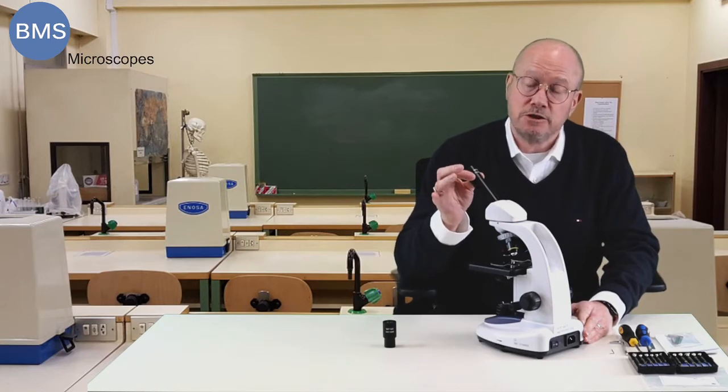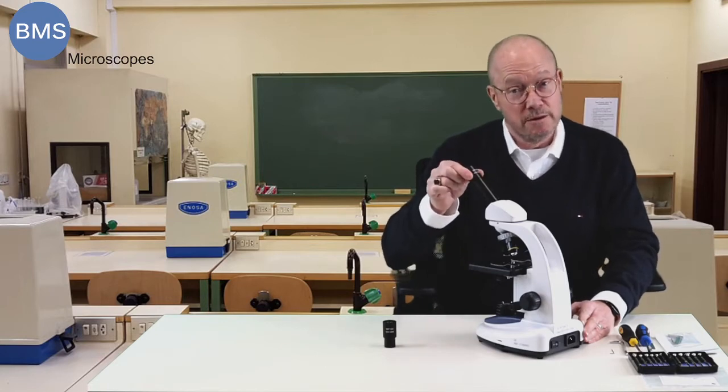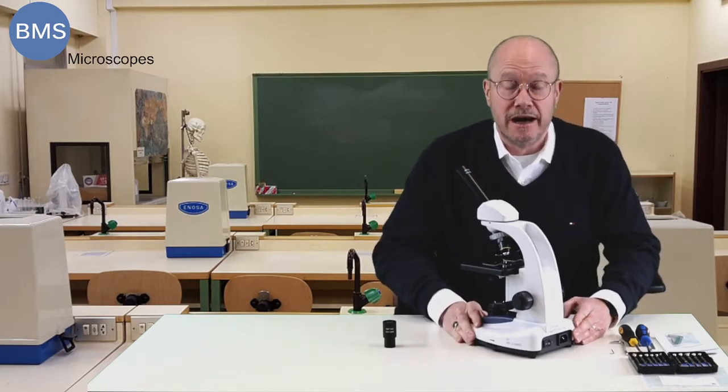All our BMS Microscopes have eyepieces that are secured in the tube. So you can't just remove that. You have to do something to get them out.